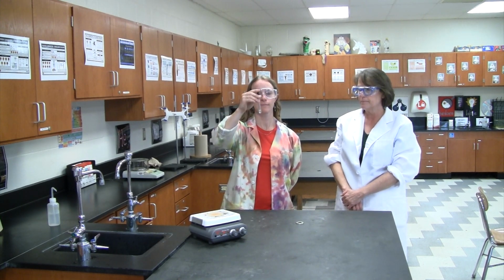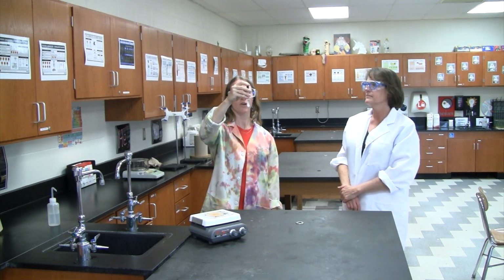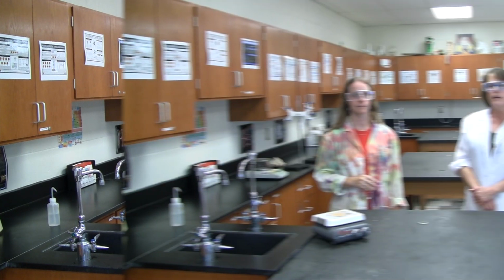In this final set of tests, we'll be examining a variety of solute and solvent combinations. Record your observations in data chart number 4. The first combination is distilled water and KCl. No crystals. In test B, we have KCl and ethanol. Crystals. In step C, we have KCl and acetone.